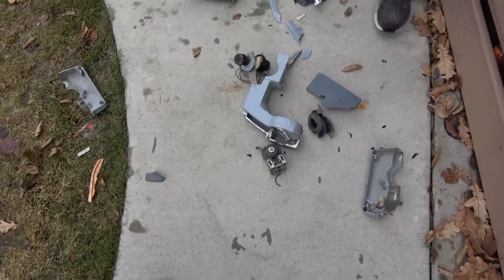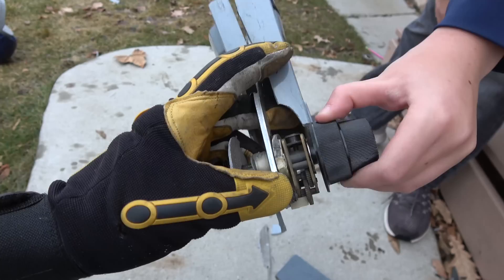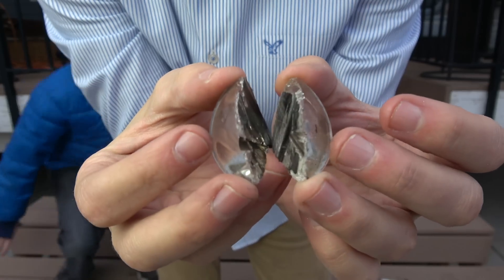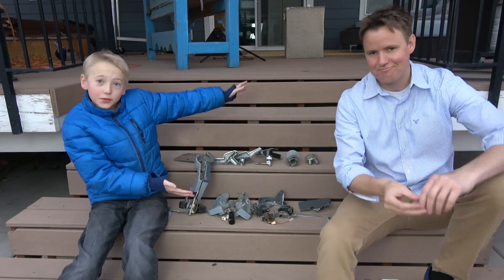Boom. Drop the mic. There's the handle where you would twist it right there. Look at those gears. Here is your lens that makes the microscope function properly. And here's our work of art or masterpiece.